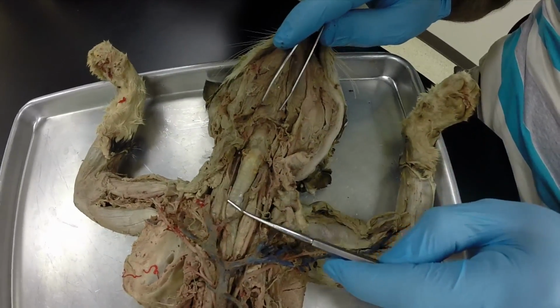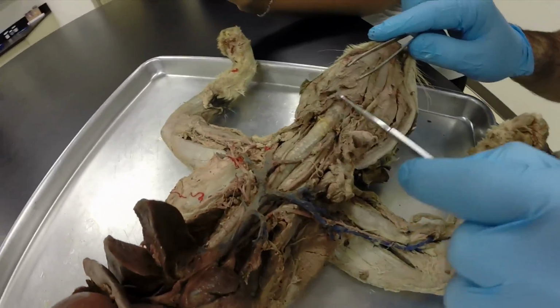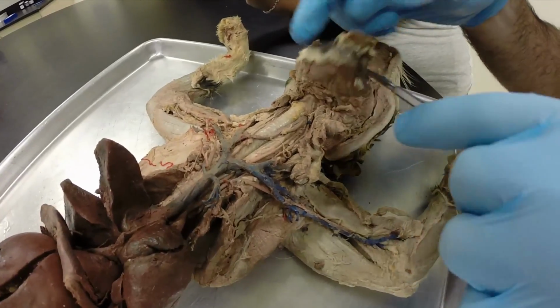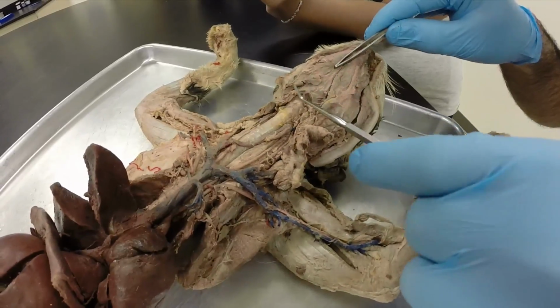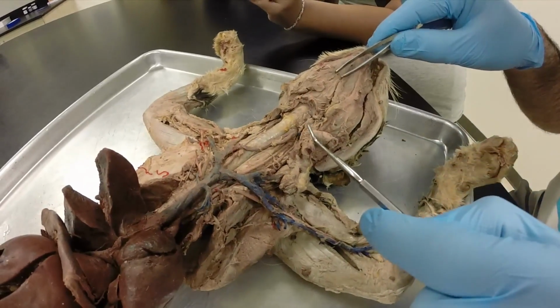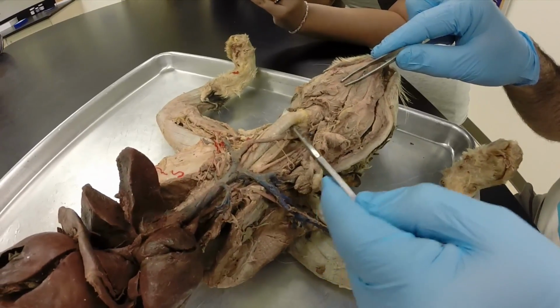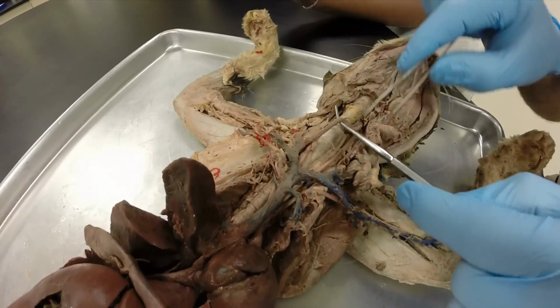And then this is our trachea right here. And there's a hard part on it, which is our larynx. And you can see the larynx from here, where the epiglottis is located. Sometimes you can also cut it across right there and open it up, but I've left it intact. So this is your trachea. It looks kind of like a vacuum cleaner or shop vac hose. It's held open by these cartilaginous rings.